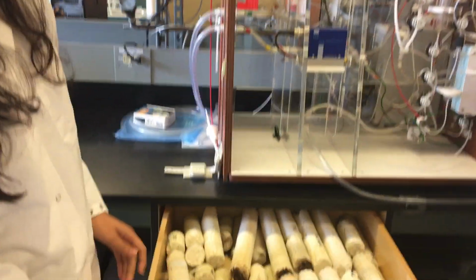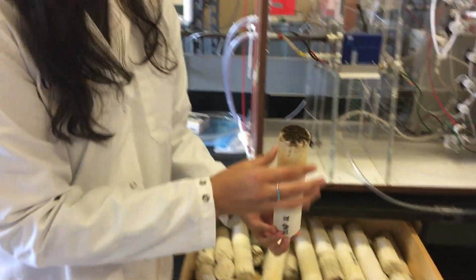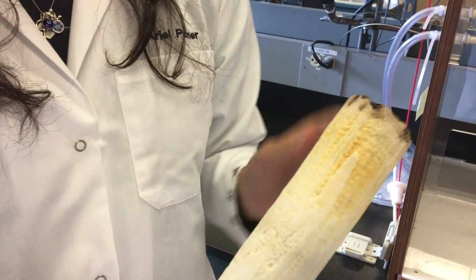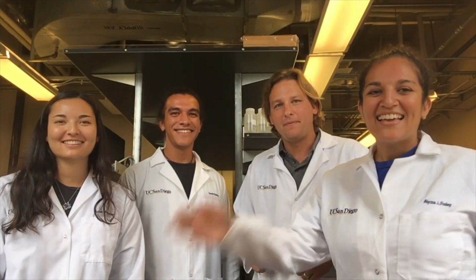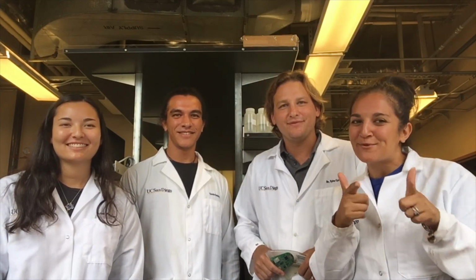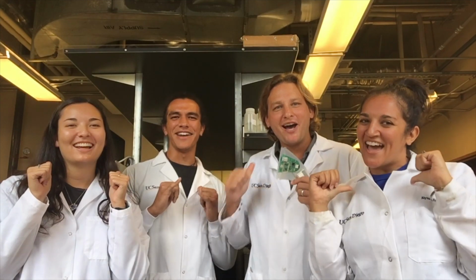And I'm interested in looking at how coral reefs are affected by multiple stressors, including ocean acidification and hypoxia. And to do that, I've been taking coral cores from different corals in the seagrass and on coral reefs to compare how growth patterns differ in different parts of the reef. Thanks for visiting our lab. And if you don't think marine chemistry is cool, then you haven't met us.